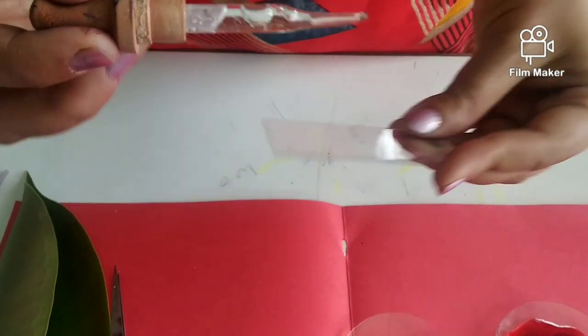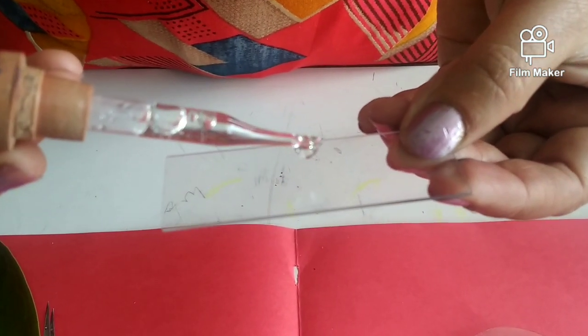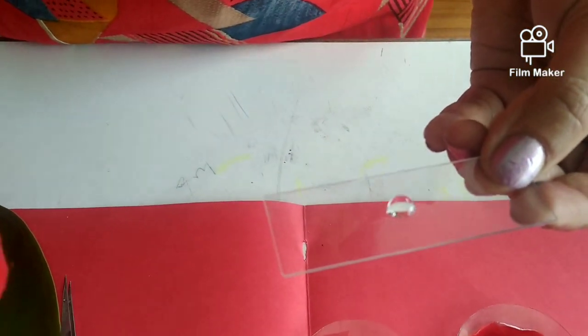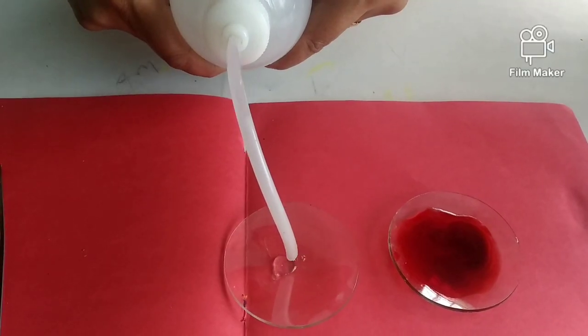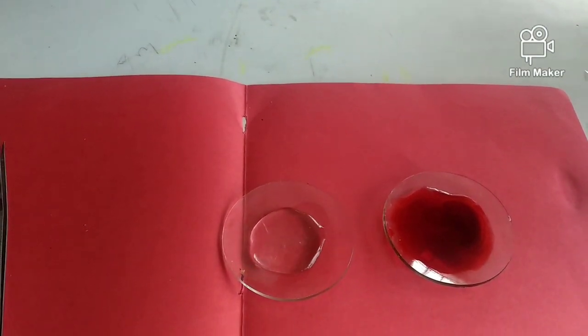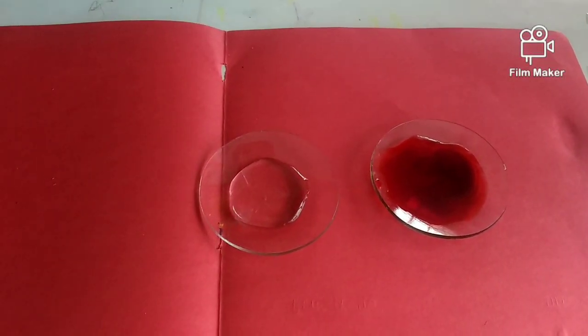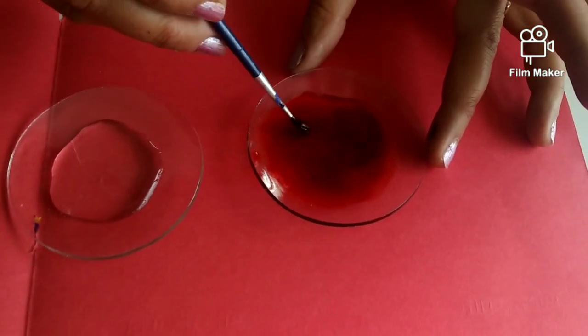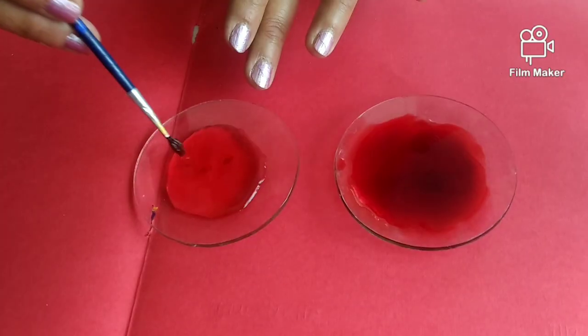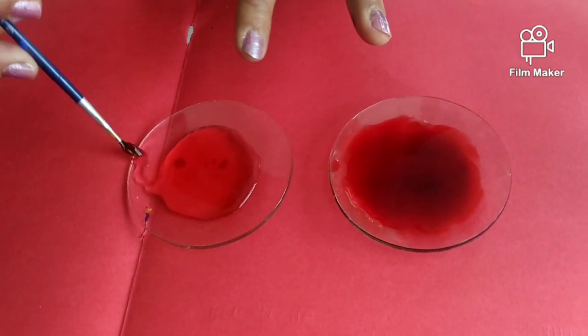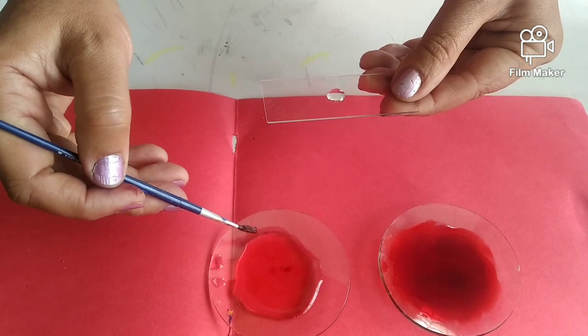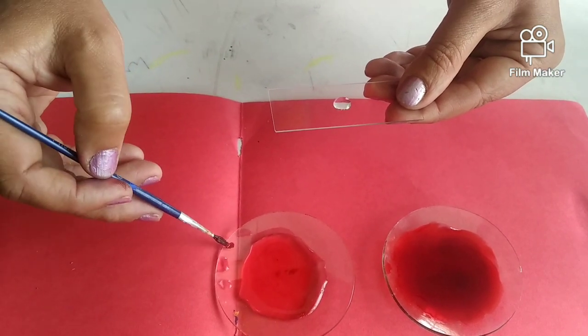Glycerin is a mounting reagent and it prevents drying up of the specimen and also helps in getting a clear picture under the microscopic lens. After two to three minutes, transfer the specimen from the dye to the water. In the water, the excess stain can be removed.